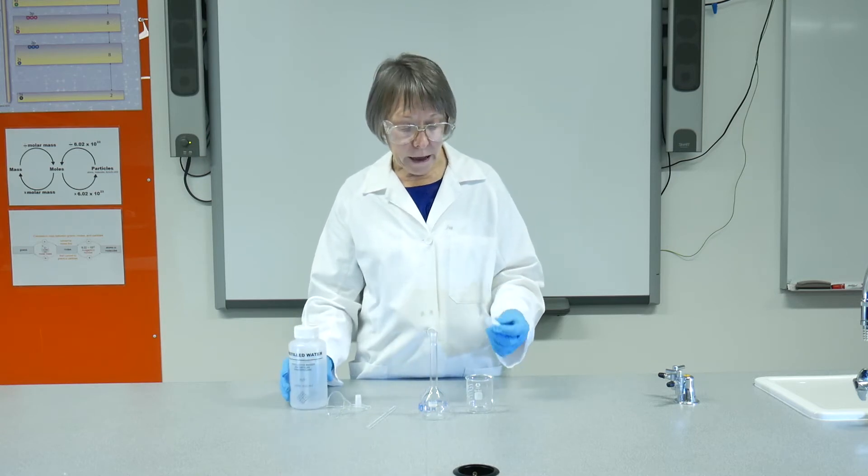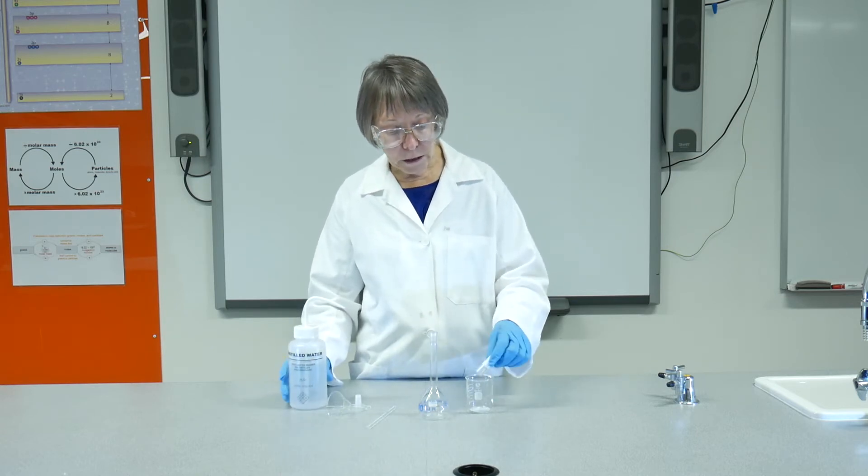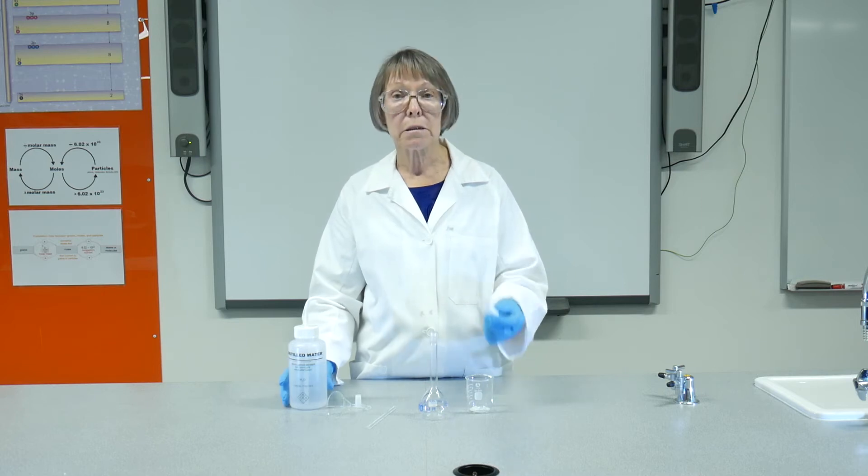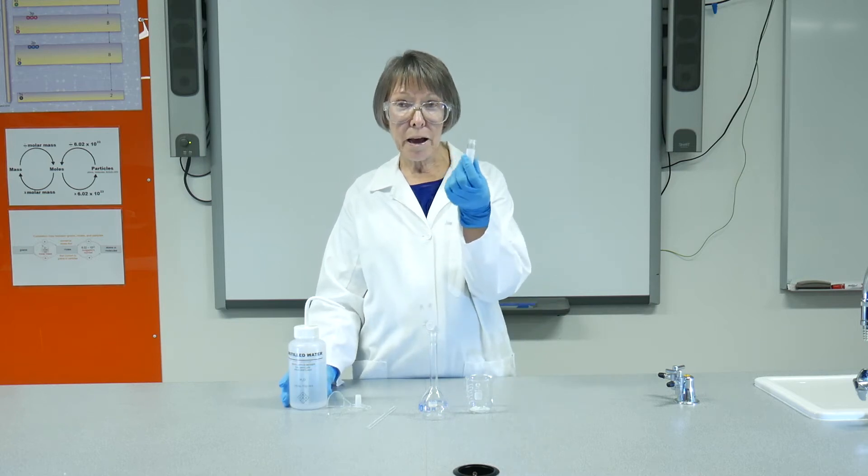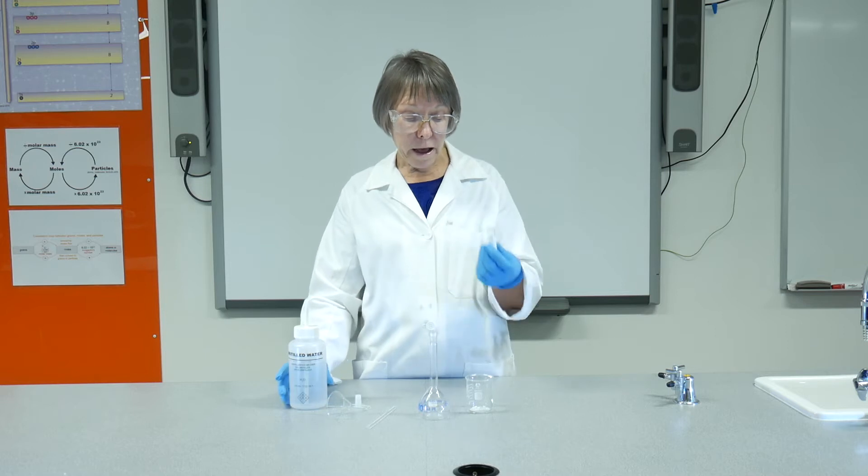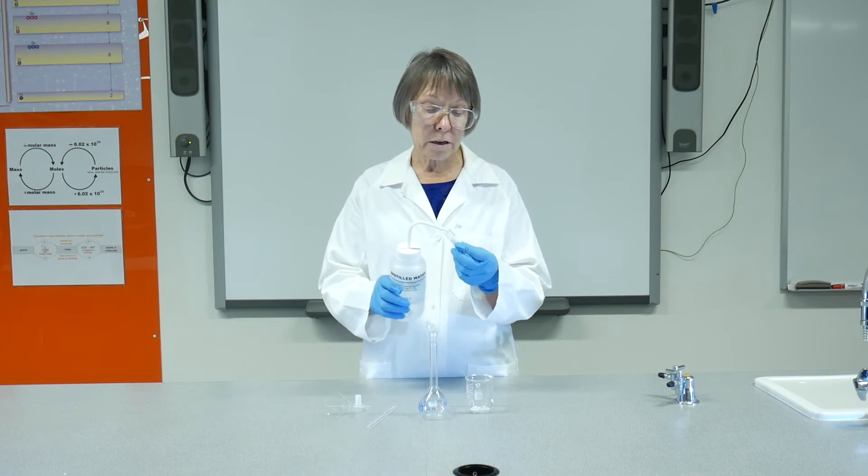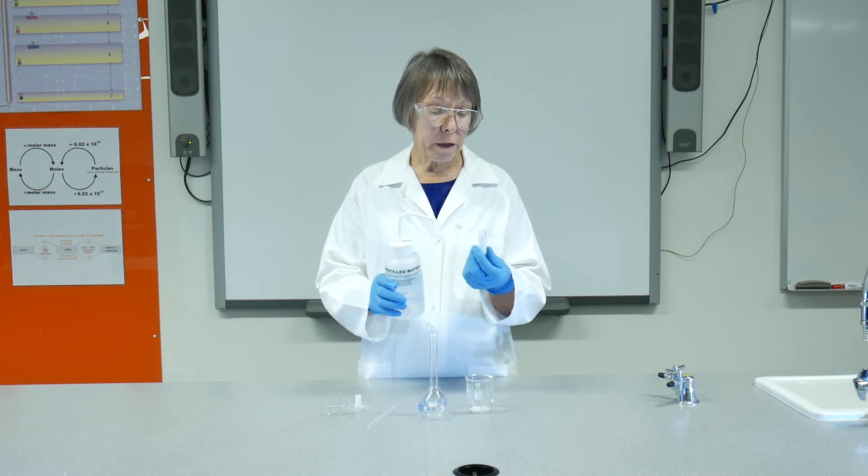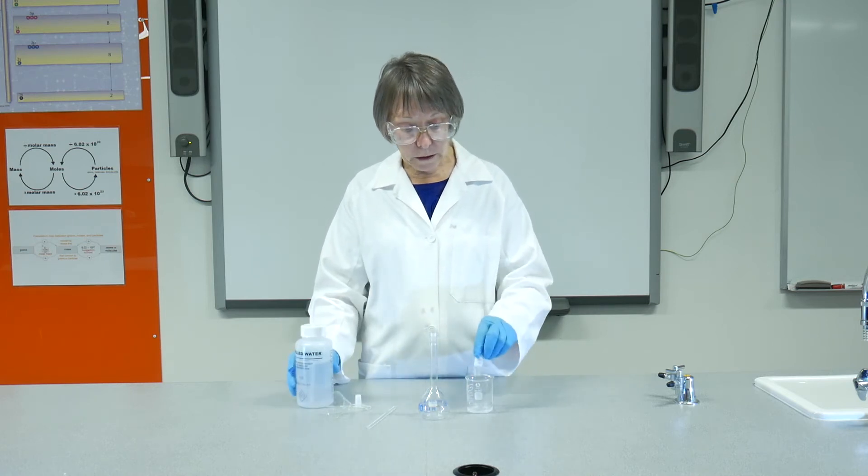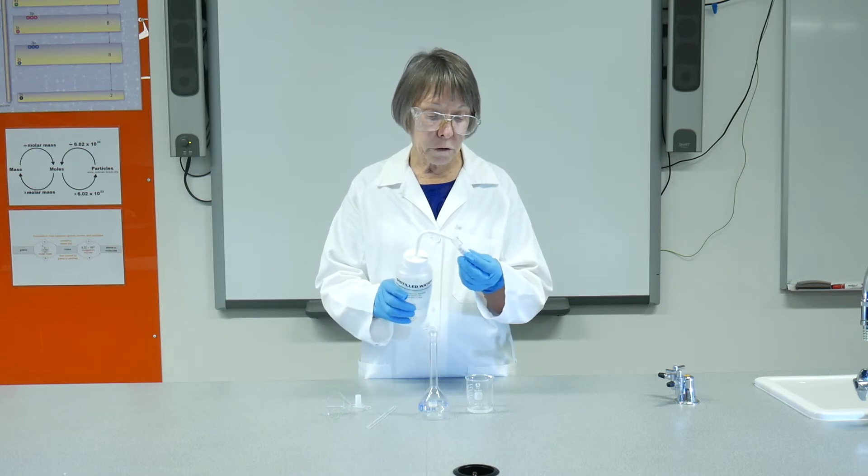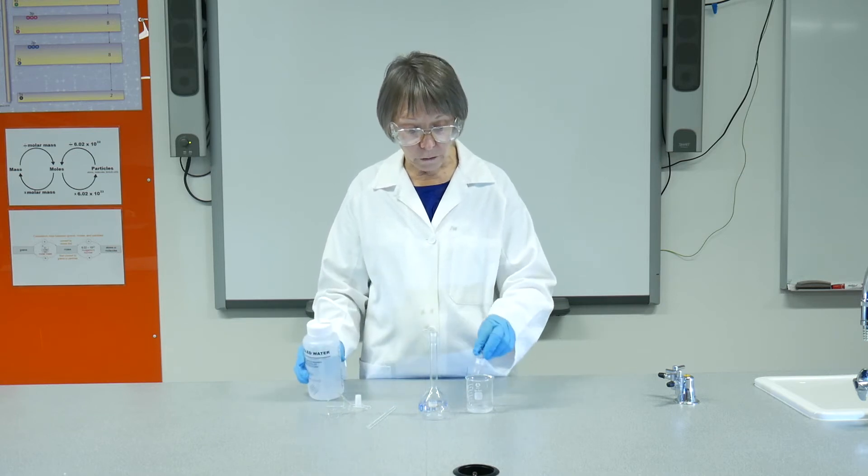That means that I need to make sure that I get every little bit of that KHP out of the vial, and later on that I get every bit of the solution out of the beaker into the flask. So instead of just pouring in some water to dissolve the acid, I'm going to use the water that I rinsed the vial with.